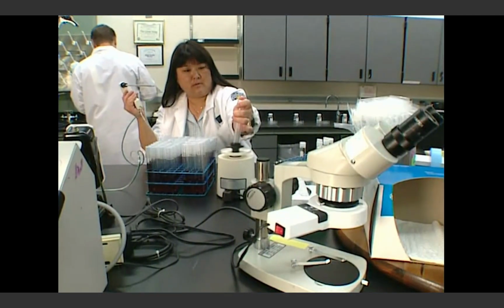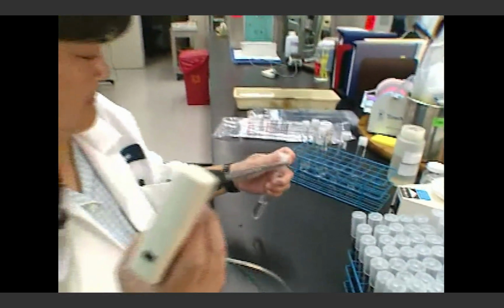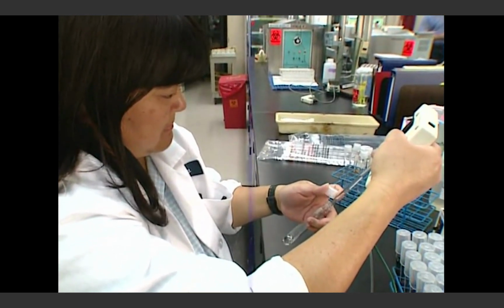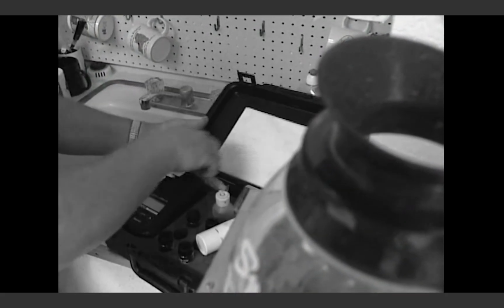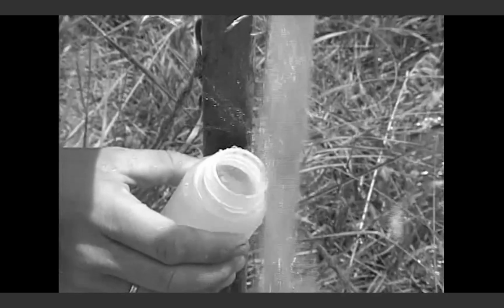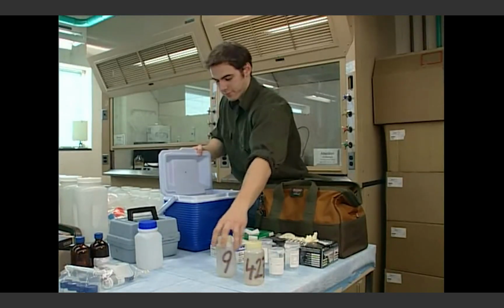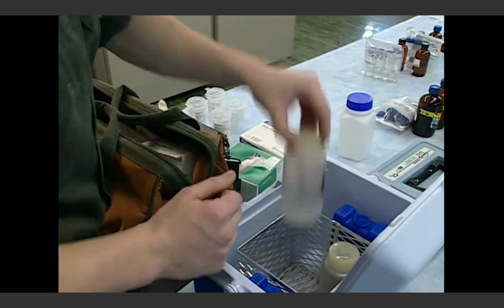It is important to remember that to get a good sample for testing, you must use proper sampling techniques. This ensures that you have not accidentally contaminated the sample yourself. Improper sampling techniques are often the most common problem in sampling. Mistakes made during sampling may result in poor data quality for monitoring. The key is correct sampling in the field, which begins with preparation and execution.